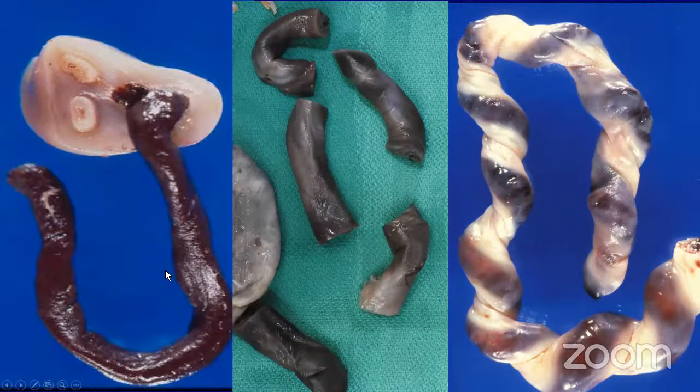I didn't say this earlier, but what I'm trying to do with this lecture is to show general features of stillbirth, not specific causes. I'll give a few examples of specific causes near the end. The left-hand panel shows a stillbirth placenta again with that ruddy-brown umbilical cord discoloration. It probably takes about a day between demise and delivery to begin to see this grossly. The extraplacental membranes are opaque, and the fetal surface is discolored — likely meconium sitting atop the chorionic surface that has not yet been taken up into chorionic macrophages. This green-brownish discoloration suggests the meconium was discharged for a while prior to delivery, not fresh meconium.